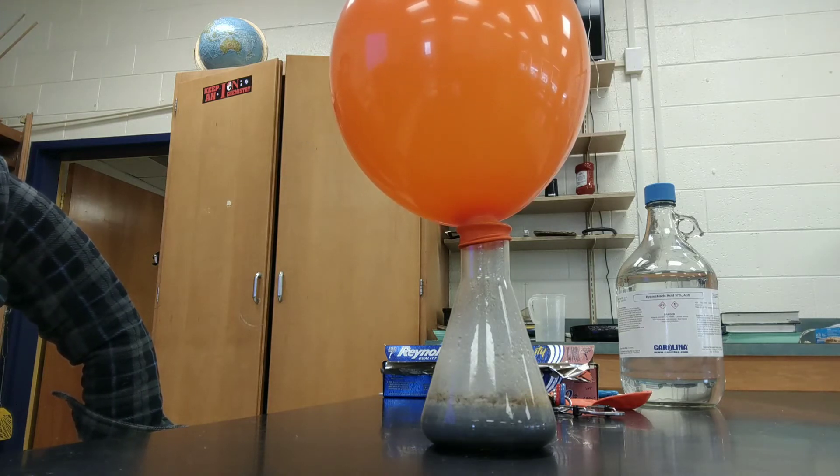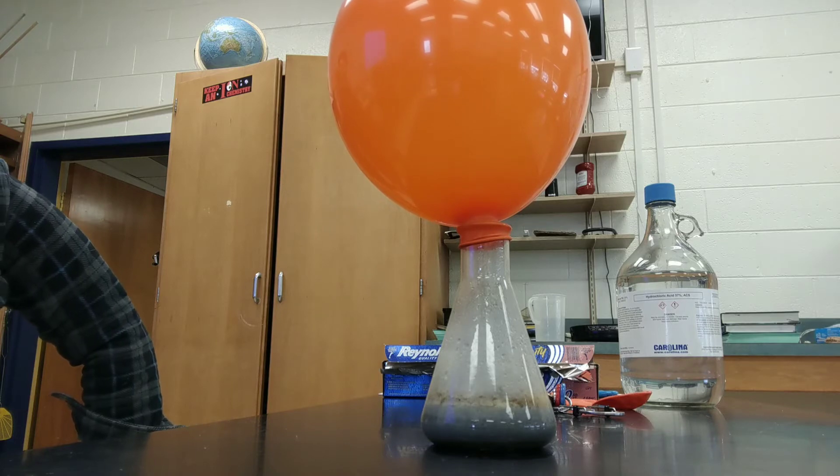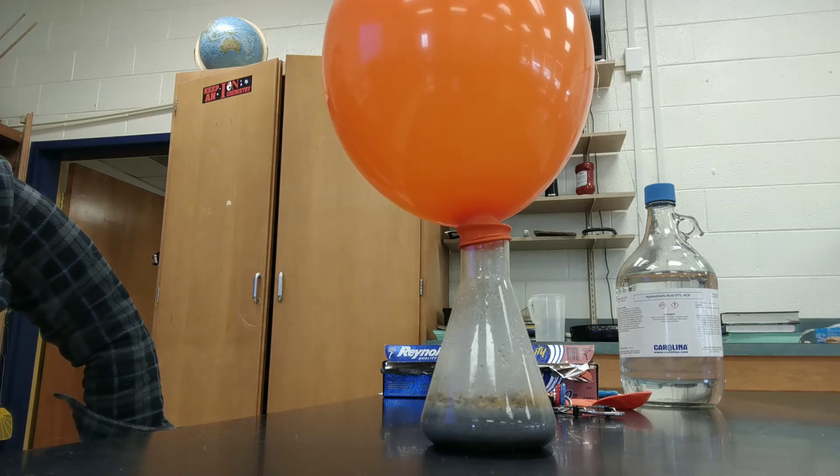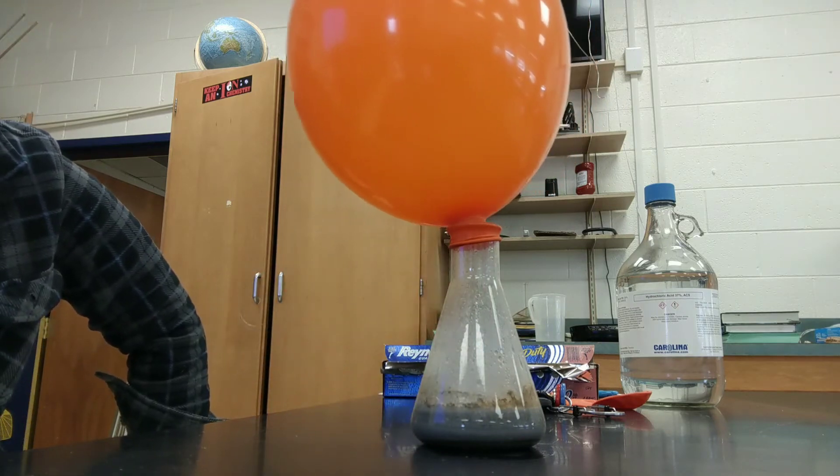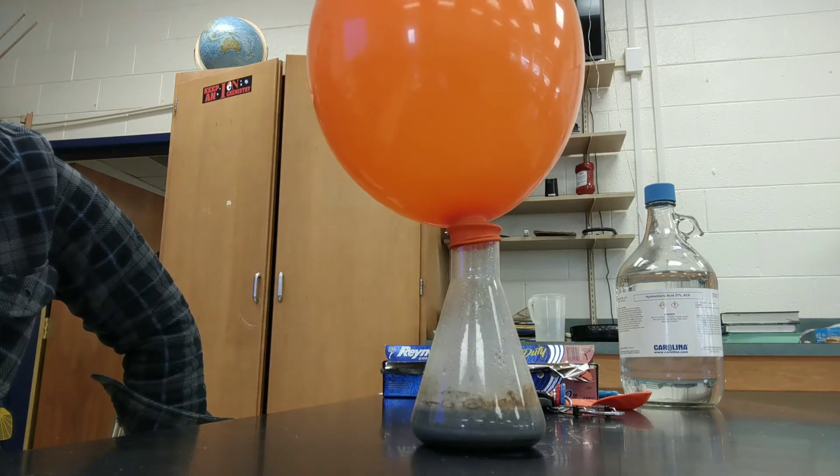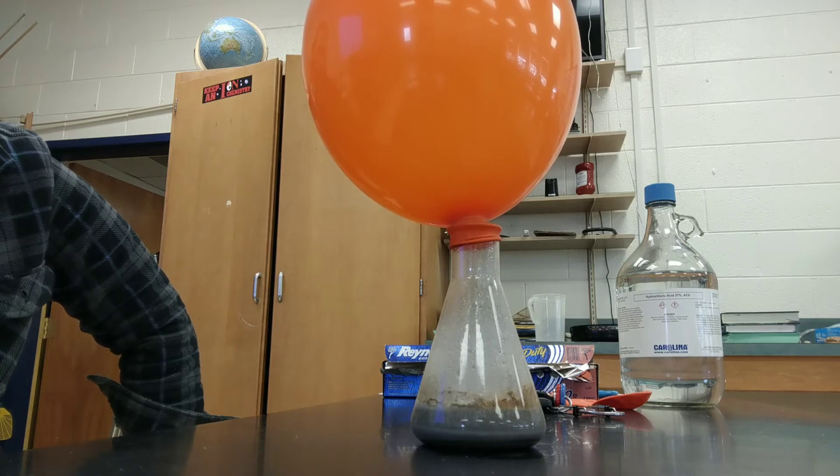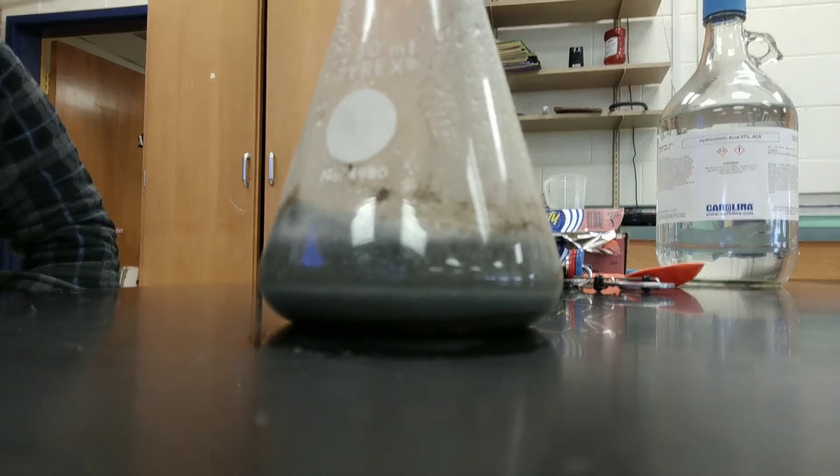The reaction is slowing down a little bit. It's super hot. It's just about done.